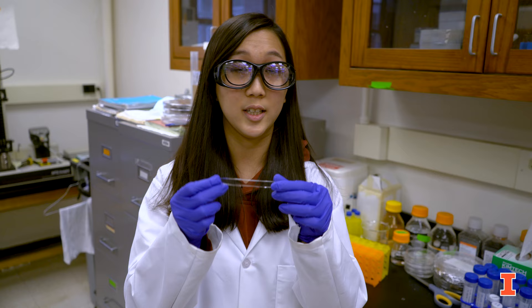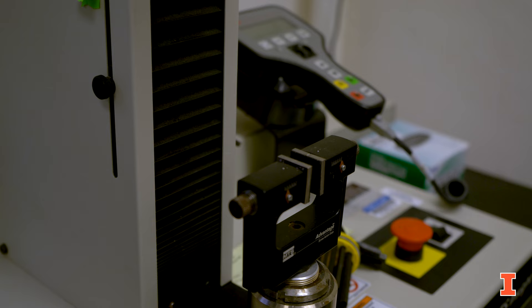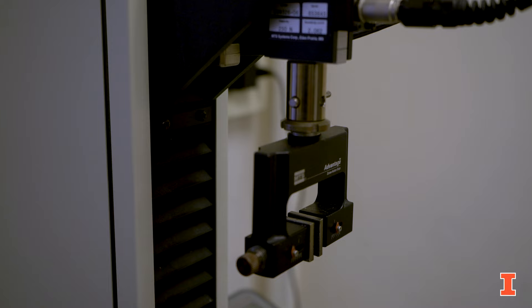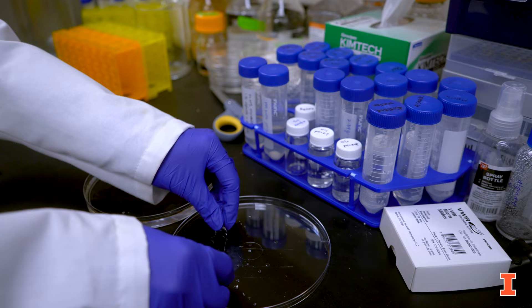Hi, I'm Joanne. I'm working on tough and stretchable hydrogels. This is our hydrogel — unlike conventional ones, ours is really stretchable and can stretch up to 10 times its original length, and we use it to make organ mimics for surgery practice. We're also looking into its non-drying property and planning to use it in wearable devices and also soft robotics.